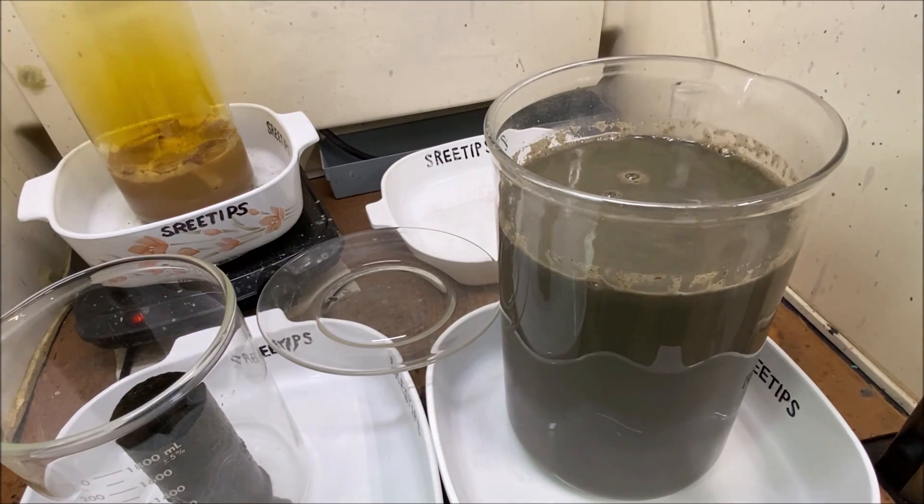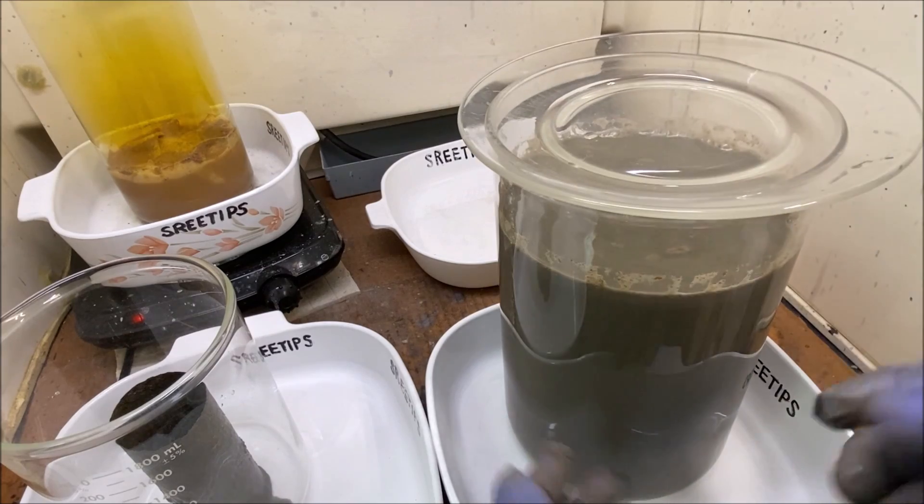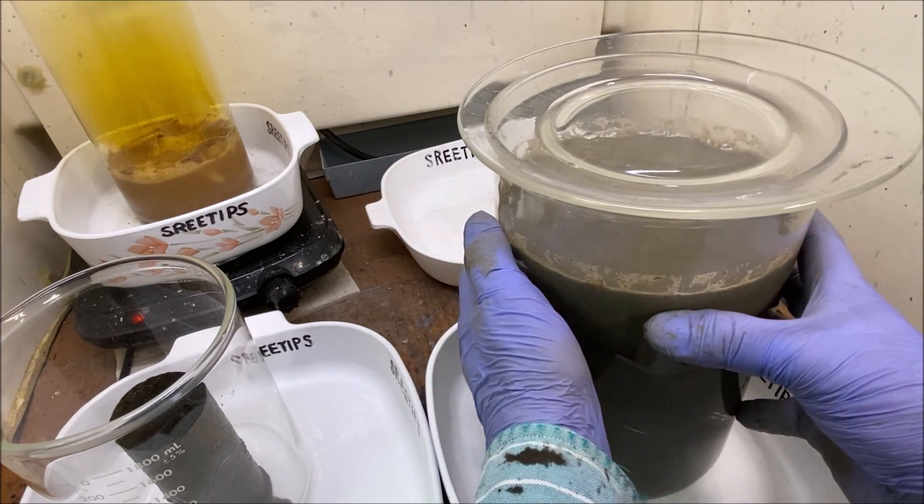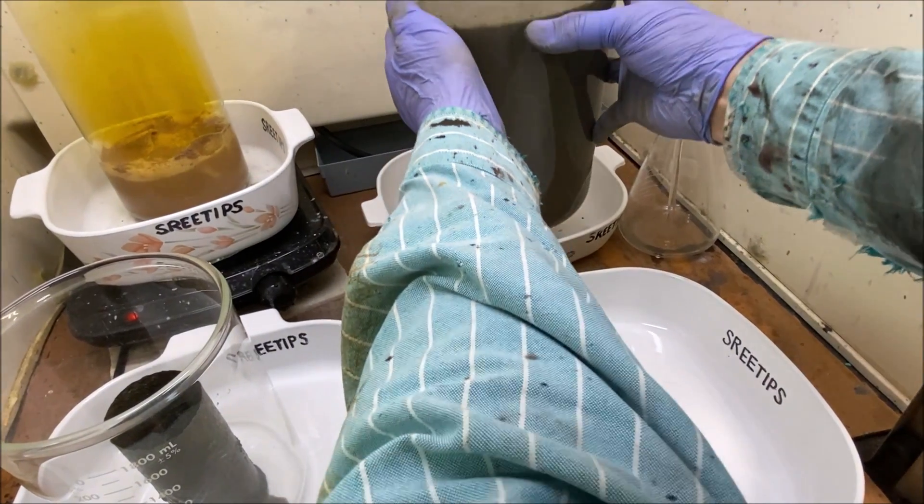Because this stuff was plugging up filters earlier, so we're going to try to rinse all the liquid material off here and then we'll try to capture the silver in a filter.